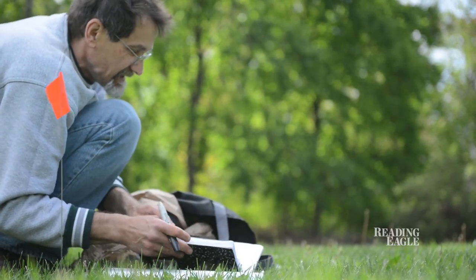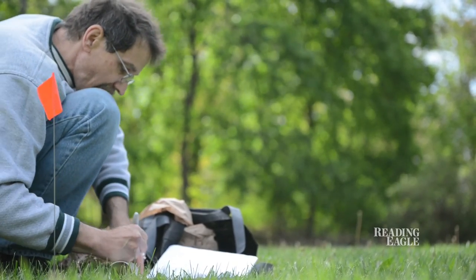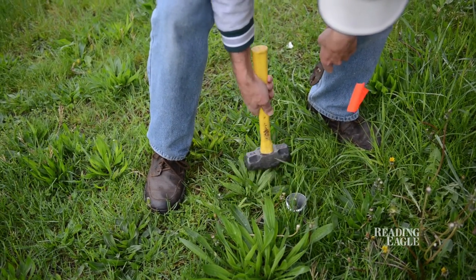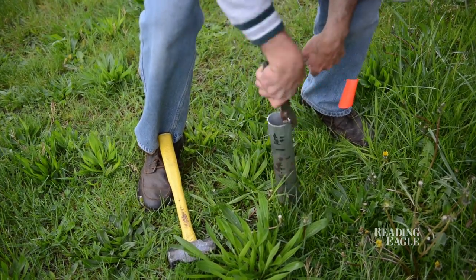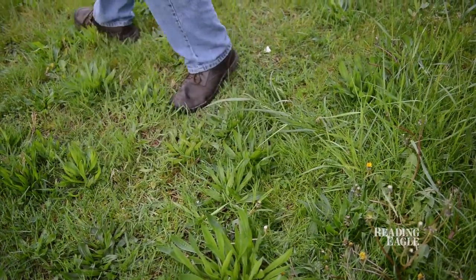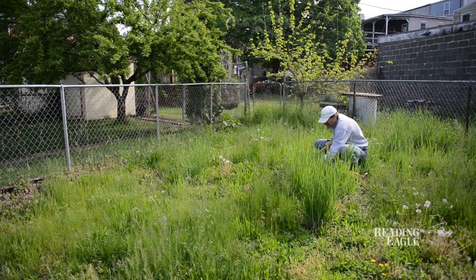From that location we will document our work. We have the street addresses of the residential properties, so using mapping we can be pretty certain — as good as GPS anyway — where they came from. We're also taking photos for documentation purposes, and I take notes to make sure that sample identifiers are straight with the addresses. The photos remind ourselves later, maybe weeks or months or years later, where things came from.